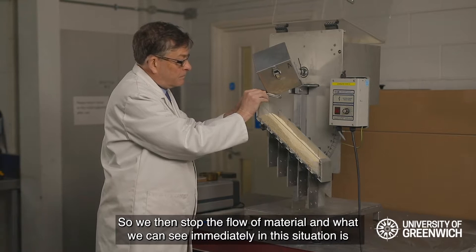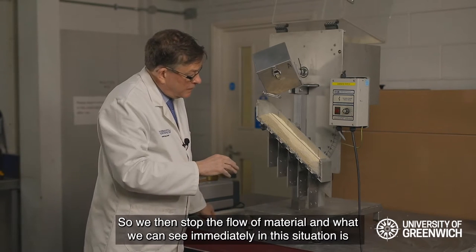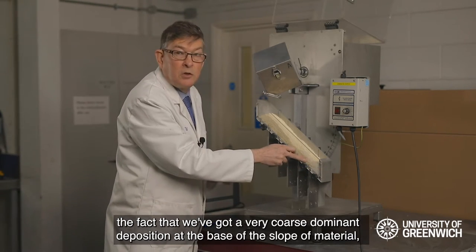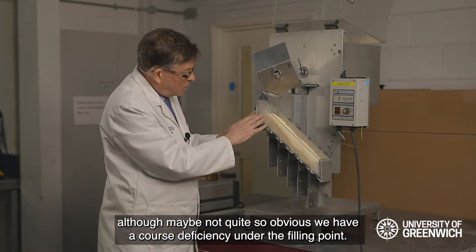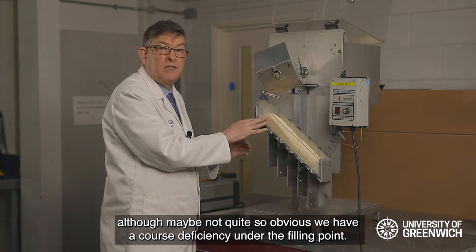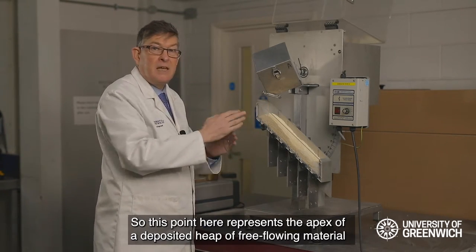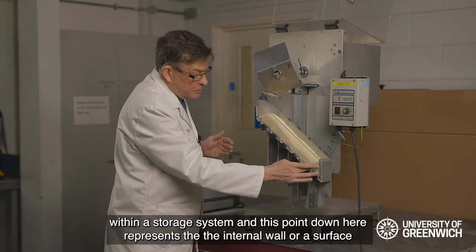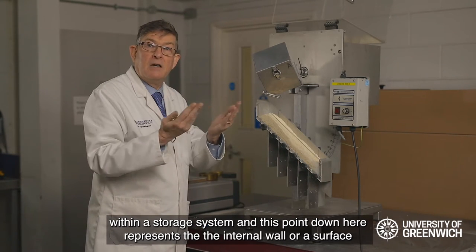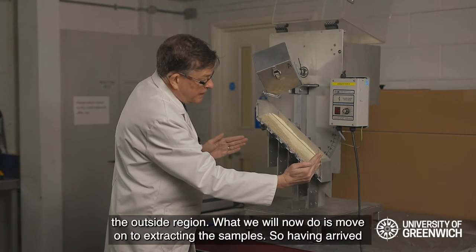Gaining access like this, we simply open the outlet and the material pours out. We then stop the flow of material. What we can see immediately is a very coarse-dominant deposition at the base of the slope, and — though maybe not quite so obvious — we have a coarse deficiency under the filling point. This point here represents the apex of a deposited heap of free-flowing material in a storage system, and this point down here represents the internal wall or surface preventing the flow of material.